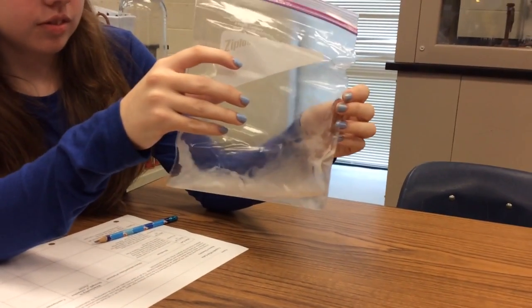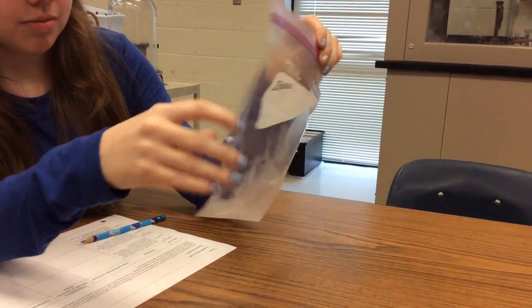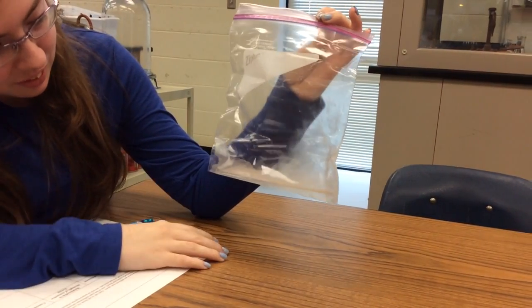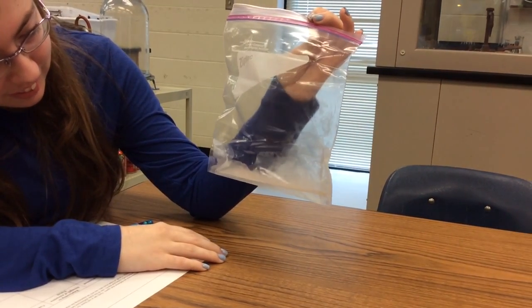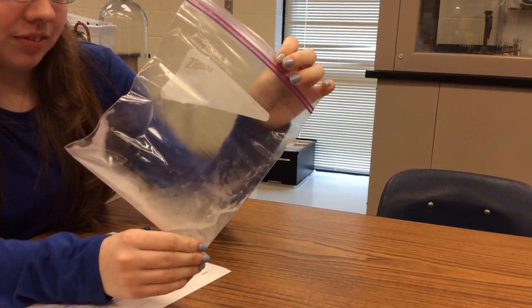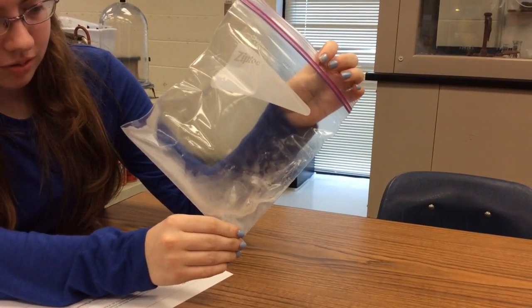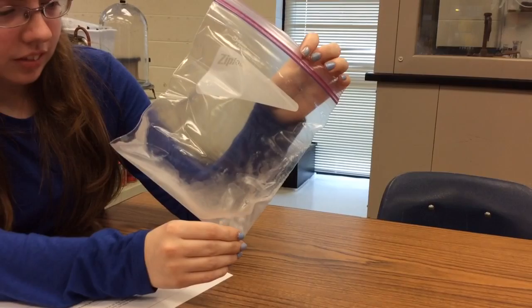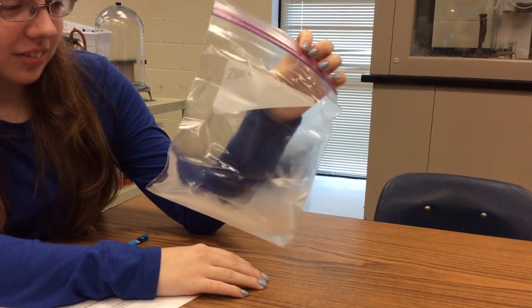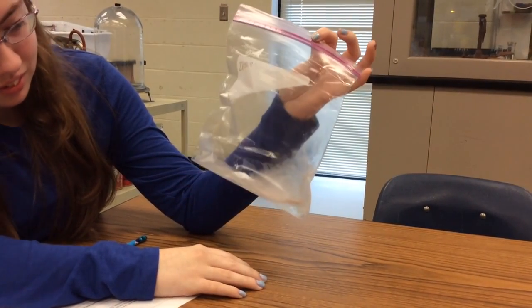Now, it first comes out as a liquid. Why is it a liquid in the container, the canister? Does anybody remember? Pressure. It's pressure. It is condensed, but it's because it is contents under pressure. You got it.